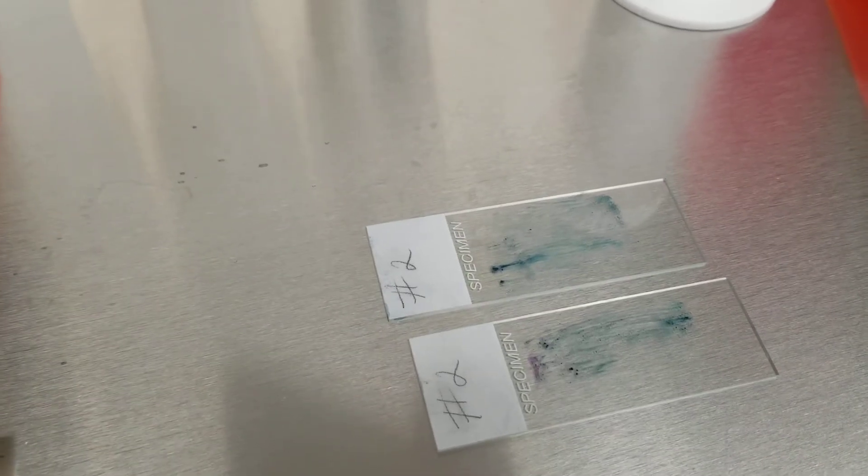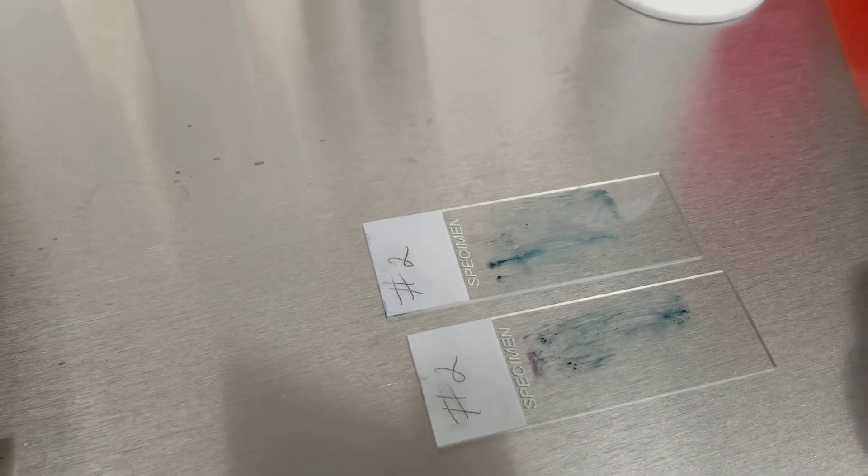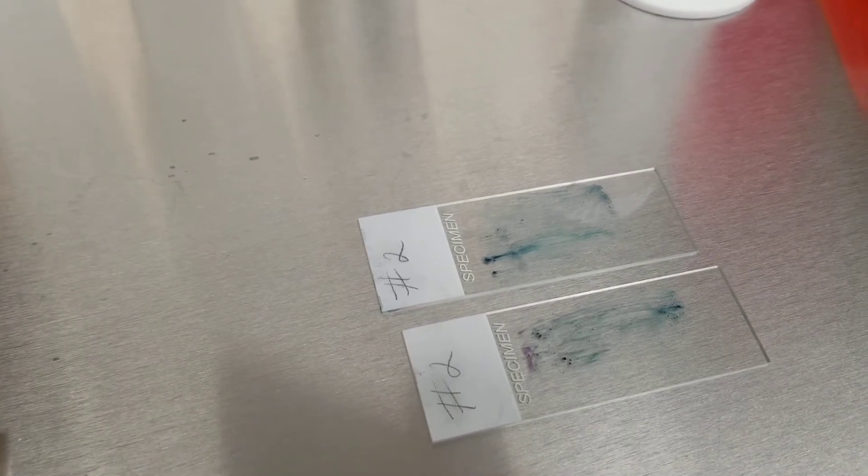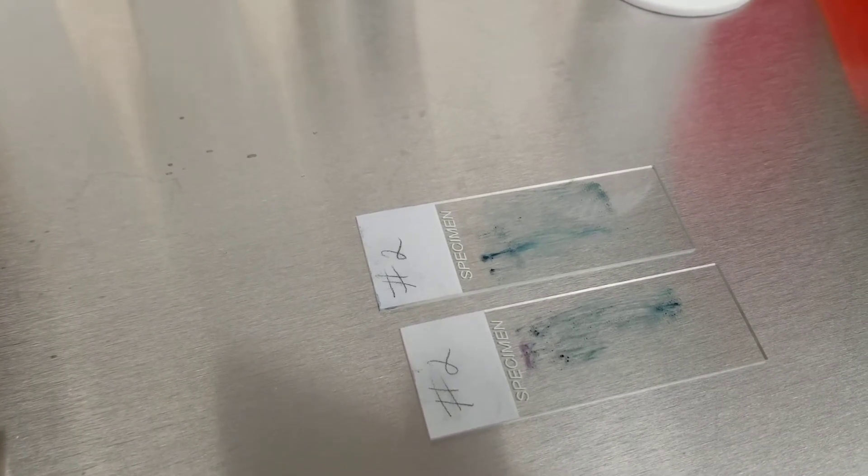Alright everyone, we're back and we're going to show you how to coverslip the trichrome stained slides that you just performed on the preserved fecal specimens.